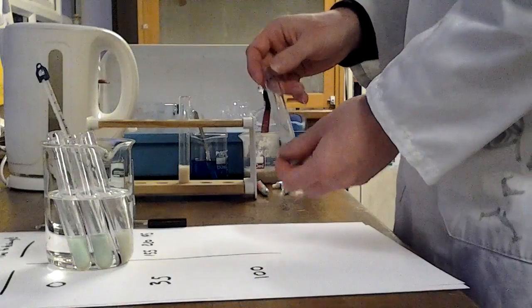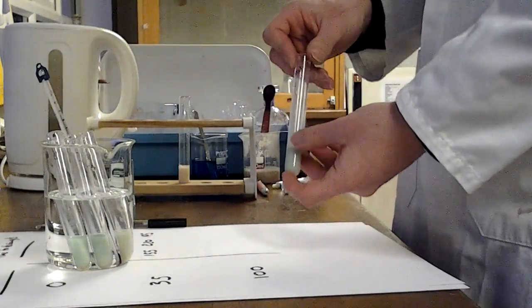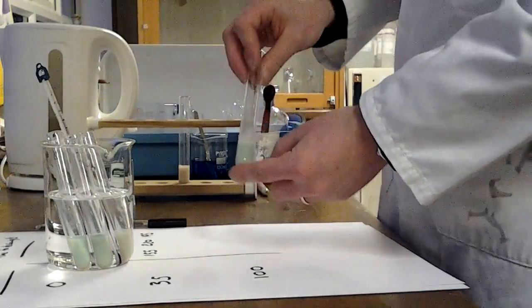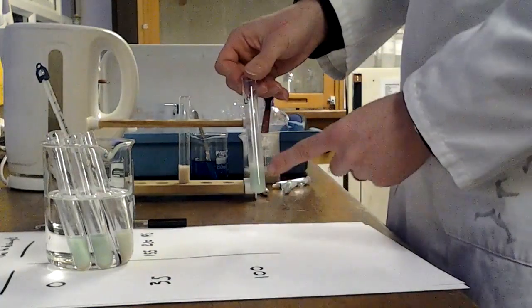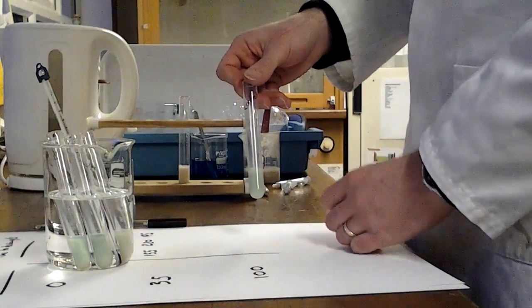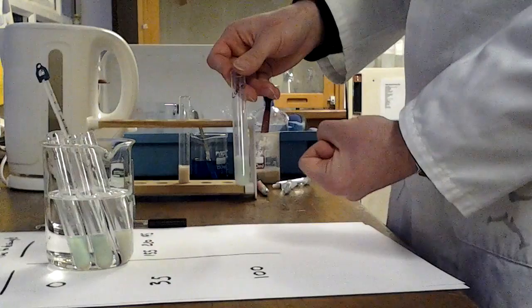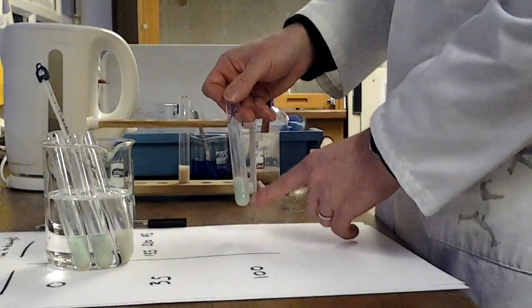So in order to do that, you are going to need to give it some yeast that is not going to be respiring, that is not active anymore. So this test tube here, this has been out on the side now for well over half an hour, and it's actually got some boiled yeast in it. So at the very start of the experiment, I popped this in a water bath with boiling water in, and I left it there for quite a few minutes to ensure that that yeast was completely boiled. The enzymes were completely denatured, and as you can see, it still has this green colour.